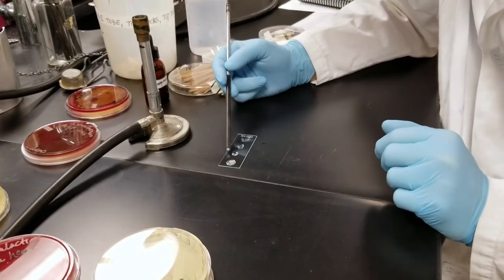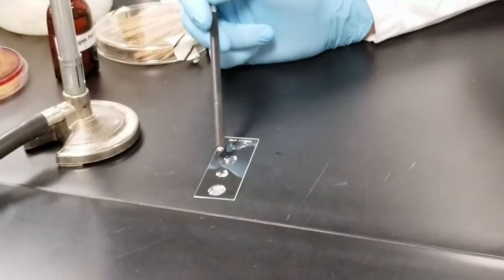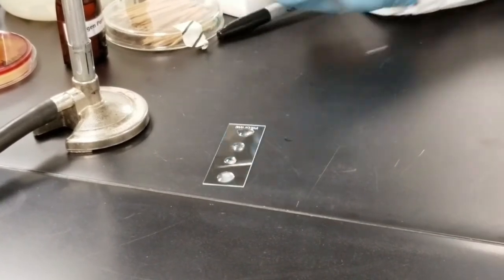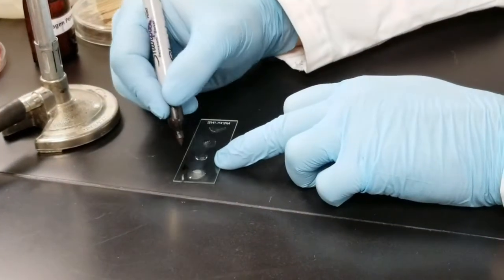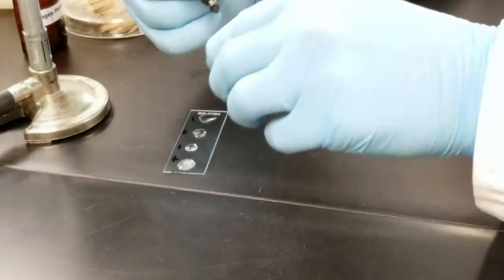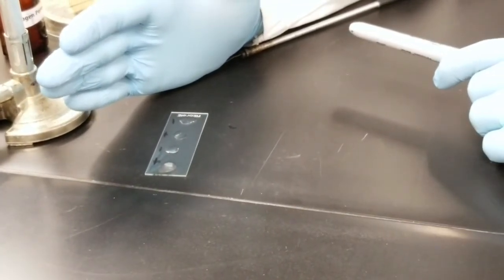Positive reaction, negative reaction. After further analysis, this third one actually looks more positive because we see a lot of bubbles, and then a negative reaction. So here we have positive, negative, negative in our reactions. And one of the giveaways is you see a lot of white coloring, so that's bubbling from the hydrogen peroxide.